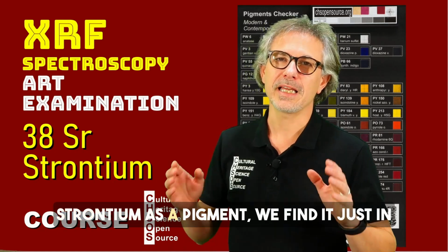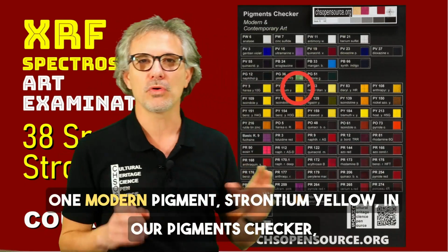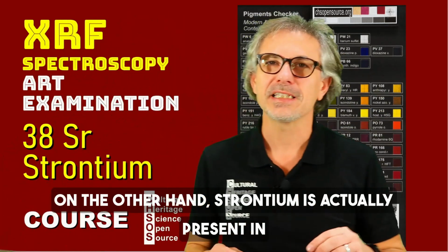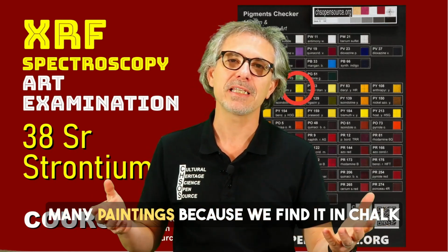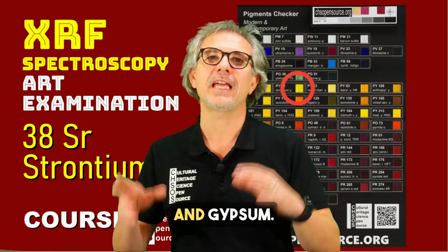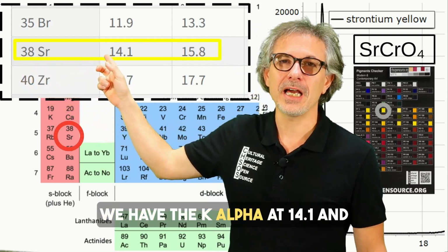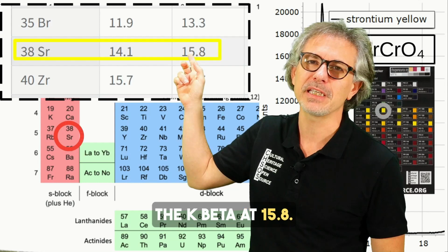Strontium as a pigment, we find it in just one modern pigment, strontium yellow, in our pigment checker modern art. On the other hand, strontium is actually present in many paintings because we find it in chalk and gypsum. Strontium has atomic number 38, with X-ray lines: the K alpha at 14.1 and the K beta at 15.8.